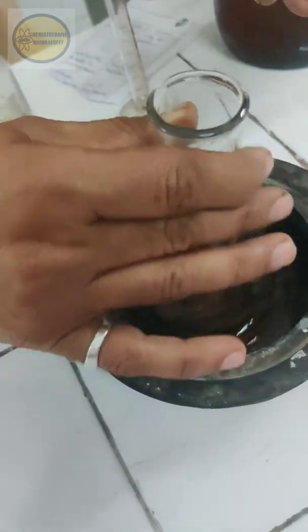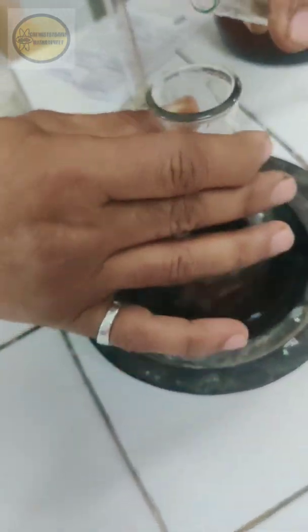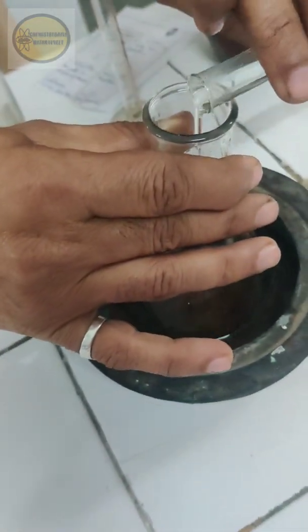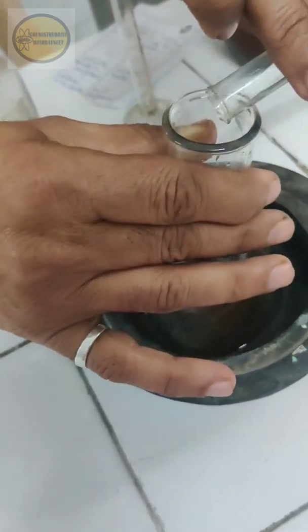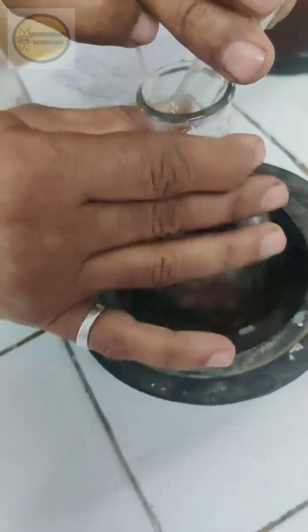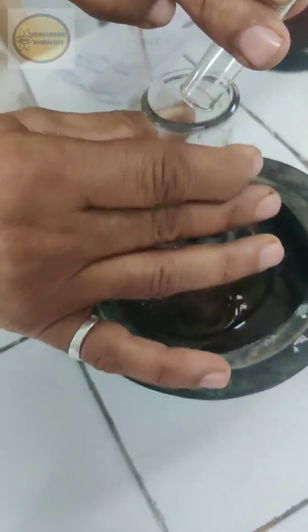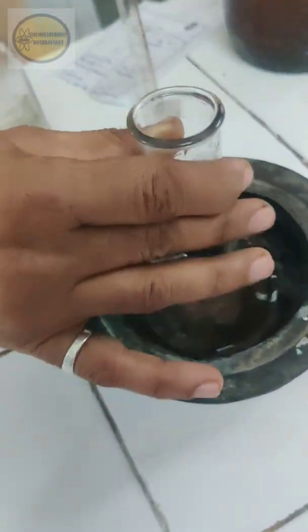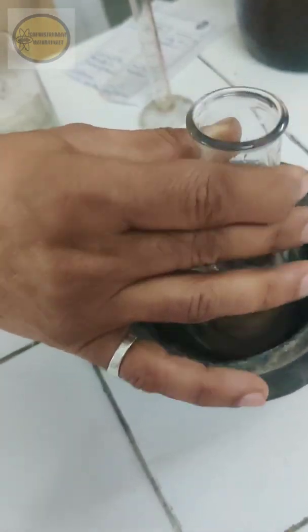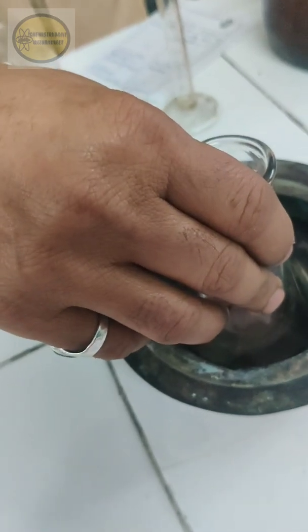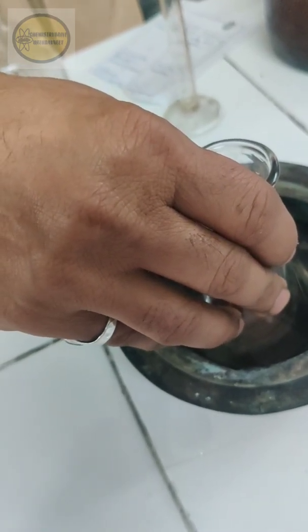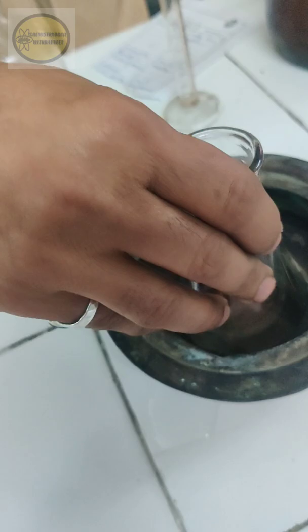So we are using our ice cold water. So put it in small installments with constant stirring. If you are doing in the beaker you can do the stirring with the help of glass rod. Once you put the whole solution and maintain the temperature below 10 degrees Celsius, you need to remove the beaker from the freezing mixture bath and let it stand at the room temperature for about 30 minutes.